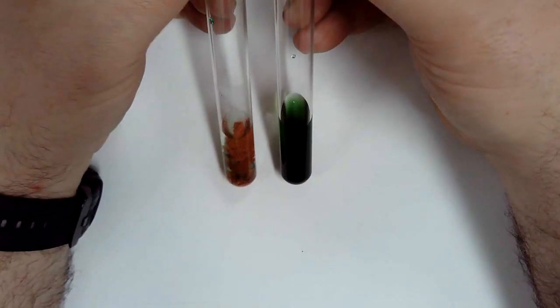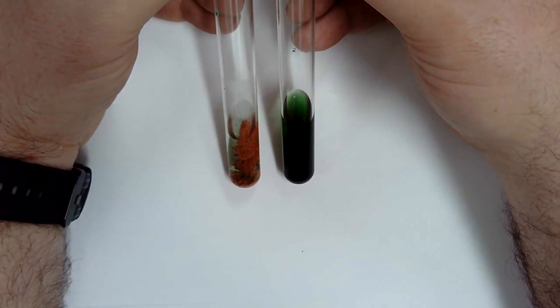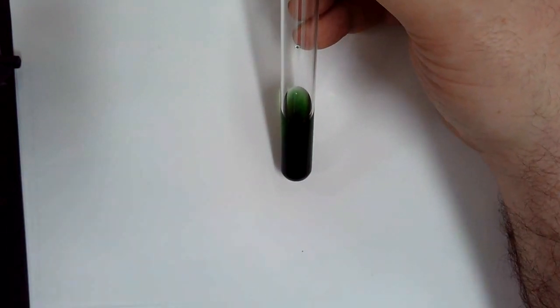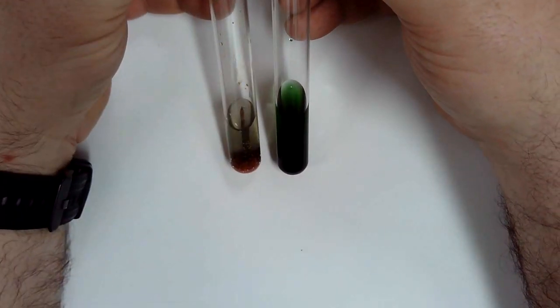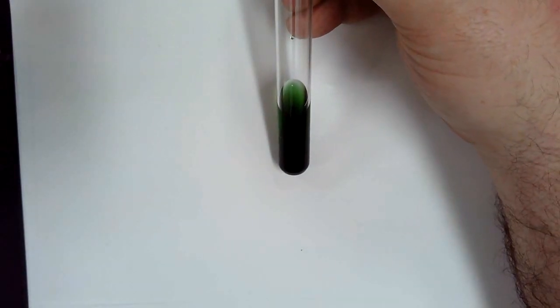So every time I do that, it's going to get darker and more of the copper is going to fall off of it. Over time, you guys are going to come and check this out a couple more times. This is to compare it against last hour. You guys see the difference? This one is third hour.